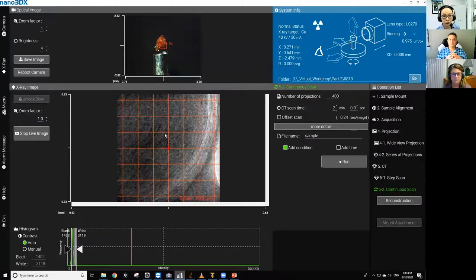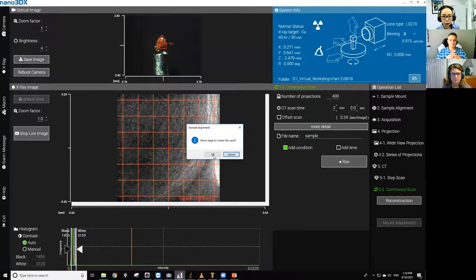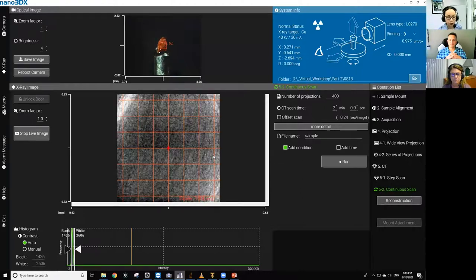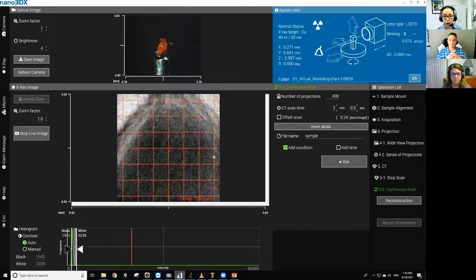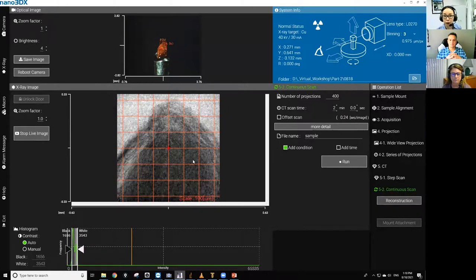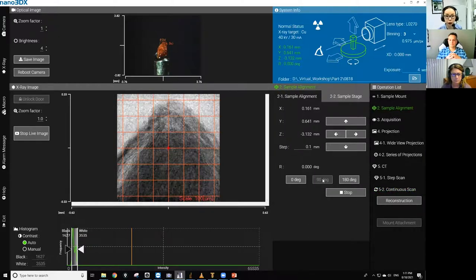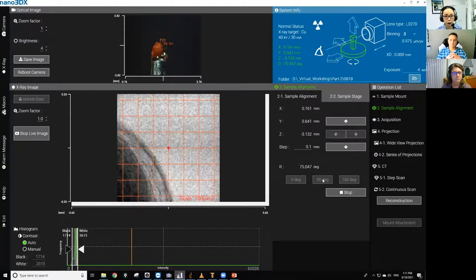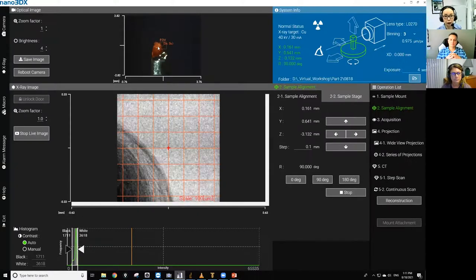Okay, we're looking at very much at the bottom. So let's take a look at this top part, the little tip of the seed. We're gonna try to do the scan in 2 minutes. So we're gonna just see the top part of the seed. But if you spend a longer time, you can scan the entire seed. So I'm gonna rotate this to 90 degrees to make sure it's not gonna go out of the view. Well, and it does a little bit.